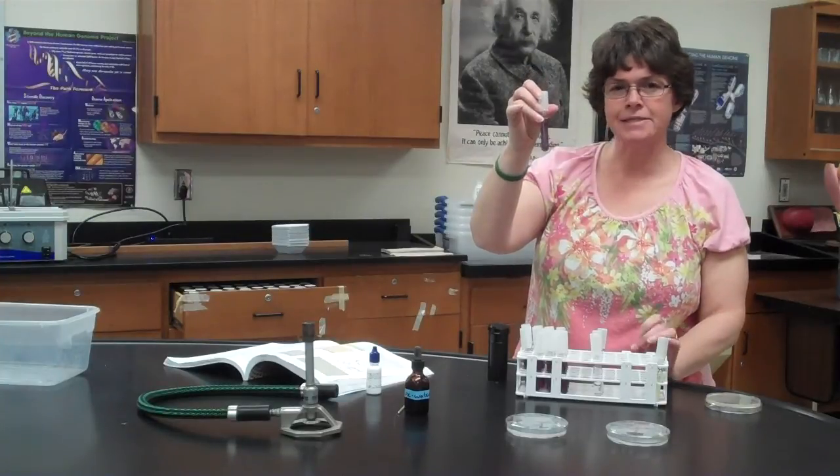On the second last lab period, a week later, you're going to be looking for fermentation, acid and gas, just like we did before. And then on the plates, you want to visually look to see if there's any sporulation going on. You can do that with a hand lens, like a little magnifying lens, but also we have the dissecting microscopes that you can use, which we will use to look at the molds. Okay, and so you'll know how to use those.